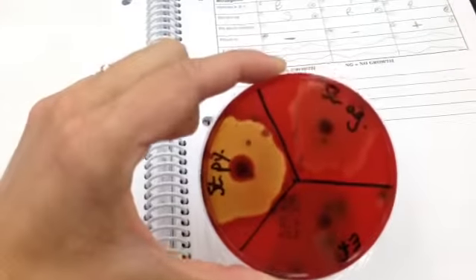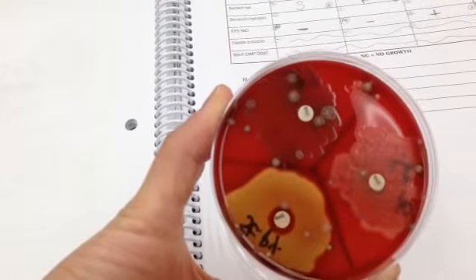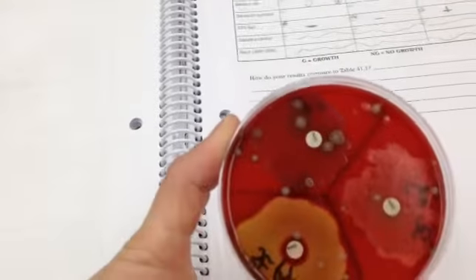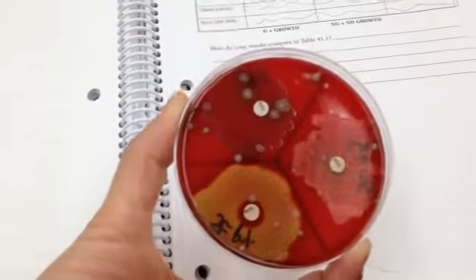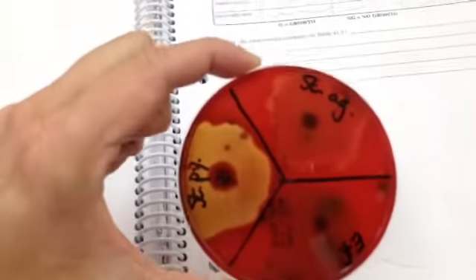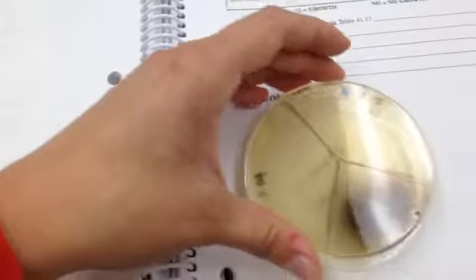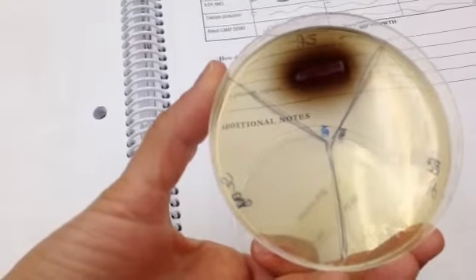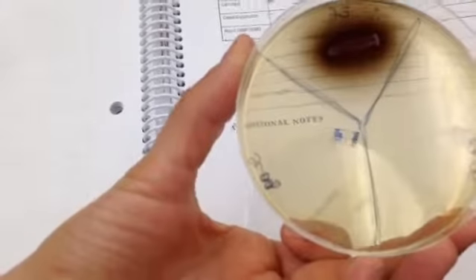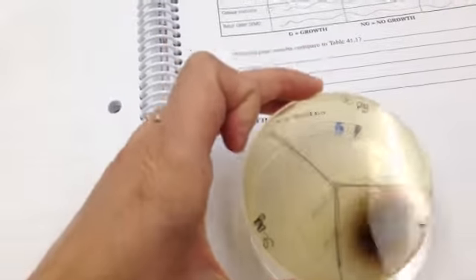The other result from this is that you can see that Streptococcus pyogenes is susceptible to bacitracin, because you see the red circle around it where the bacteria did not hemolyze. But Streptococcus agalactiae and Enterococcus faecalis are resistant to bacitracin. And the next one is bile esculin hydrolysis. Enterococcus faecalis is the only positive because it has the black pigment. Streptococcus pyogenes and agalactiae are both negative for bile esculin hydrolysis.